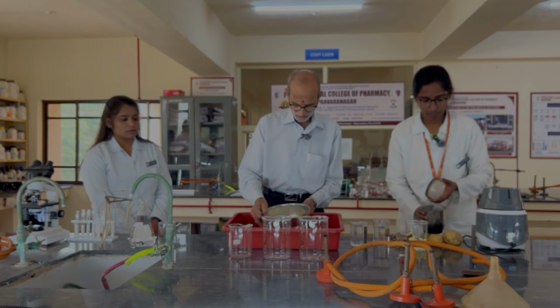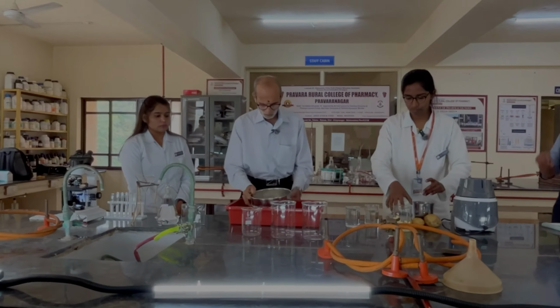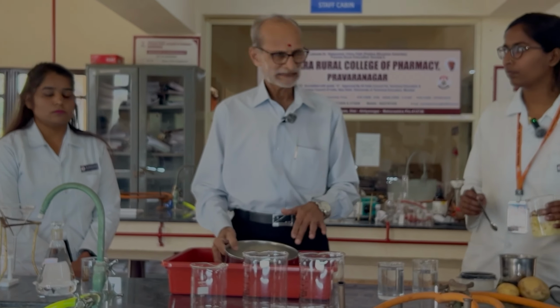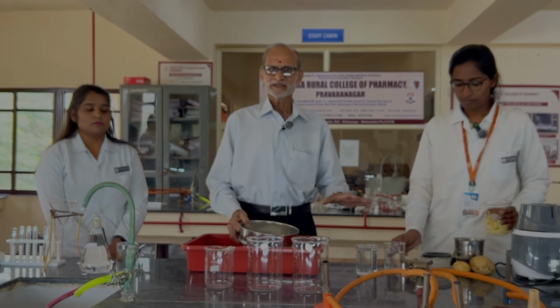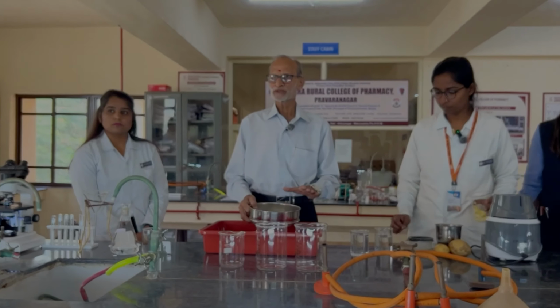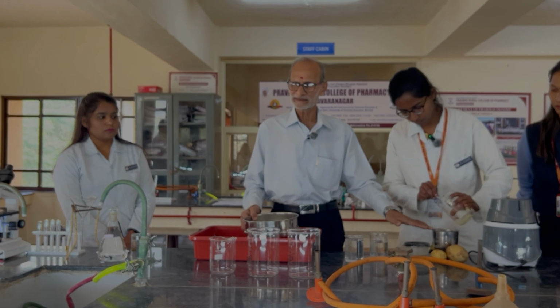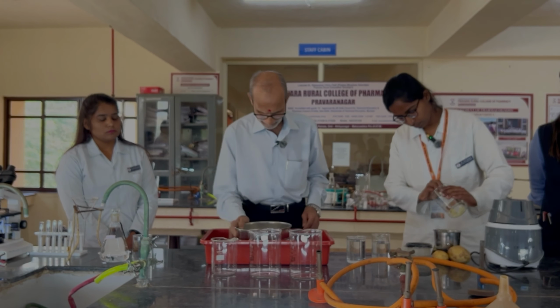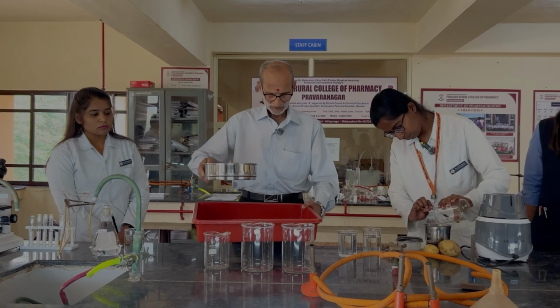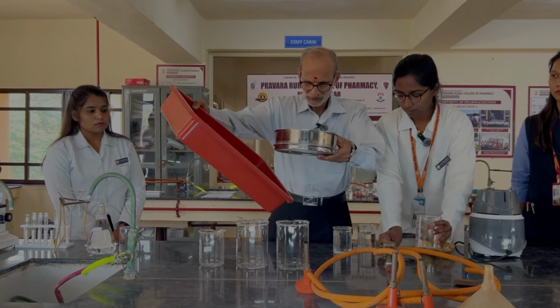Okay, so now you can see here. Now we have put a little citric acid because potato contains the enzyme peroxidase, and if you don't put citric acid, it will start becoming brown. So it is important, if you want to have absolutely white starch, to put a slight amount of citric acid in the cut pieces. Okay, we have passed through this. Now you can see here the starch, which we are going to transfer in a beaker.